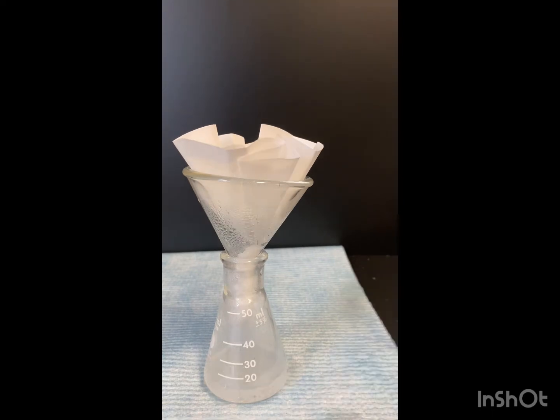While we're waiting for this to cool to room temperature, this is a good time to clean up your workstation, clean up any glassware that you may have dirtied. But we also want to get an ice bath ready as well.